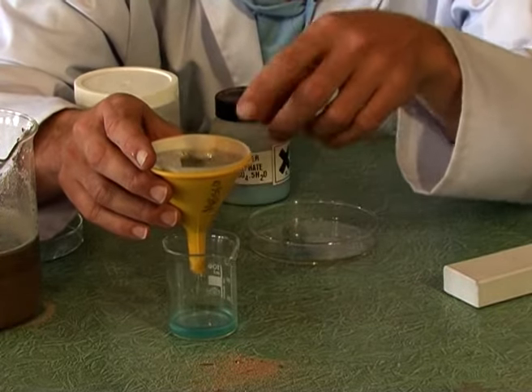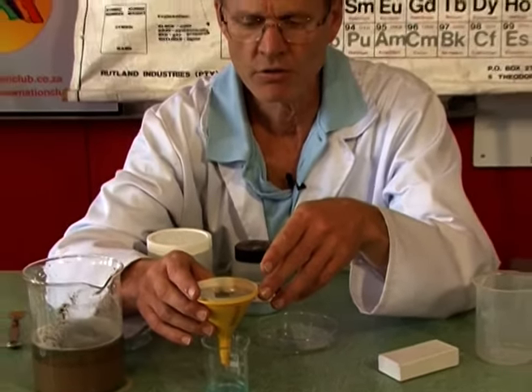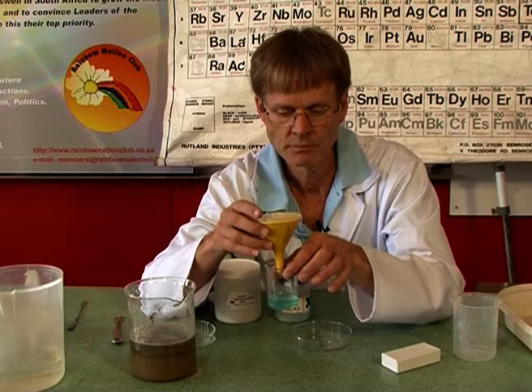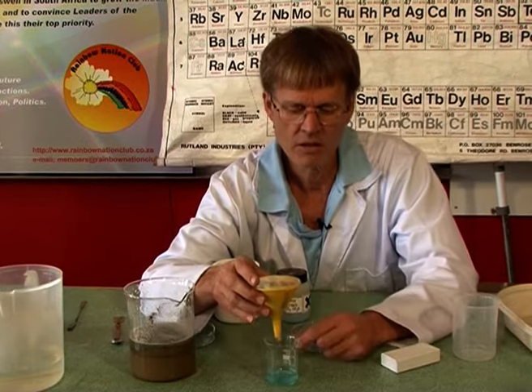Okay. Now we're not going to wait for this. It'll take a long time. But I will continue off camera, keep filtering this out. Then the question is, well, if I really needed to, I don't want salt water. How do I get the salt out of the water? Again, a different mixture. How are we going to separate the two?